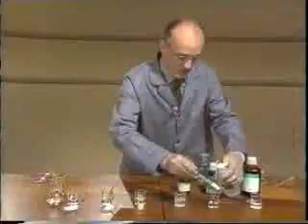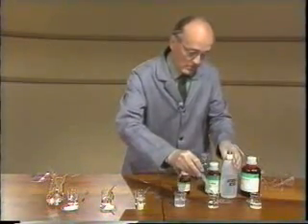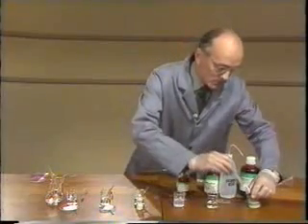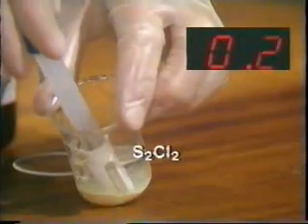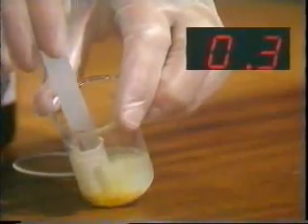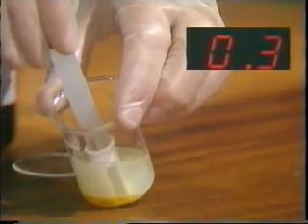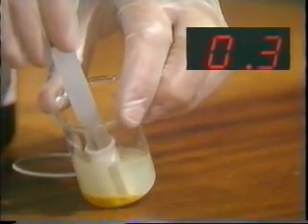Rinse the probe again before doing the last one, the sulfur chloride. And here we have 0.3.